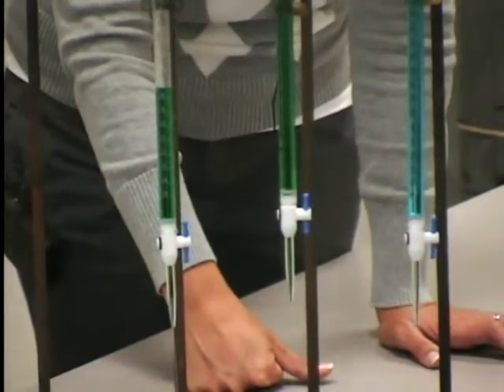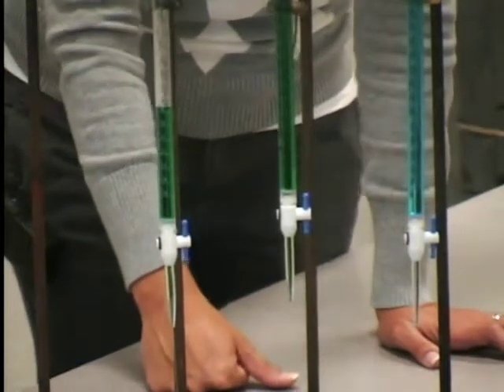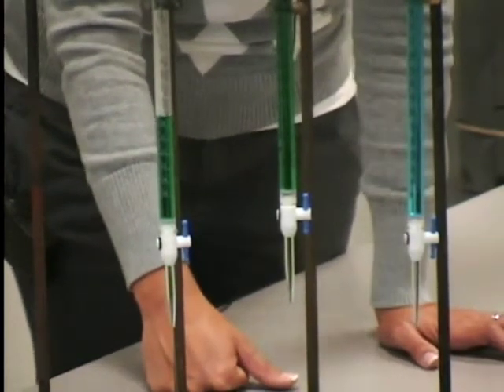And I always trust that Joe filled them up with just the right amount of liquid so that when it all runs out, the bottles catching the liquid won't overflow.